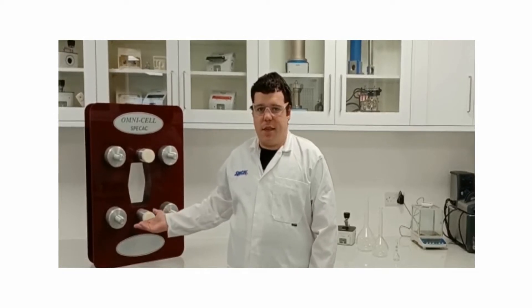Hello everyone, my name is Andrew Davis. Welcome to the demo lab, and today we're going to be talking about the OmniCell.